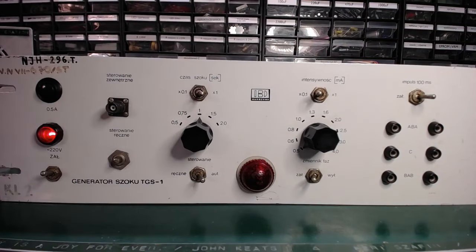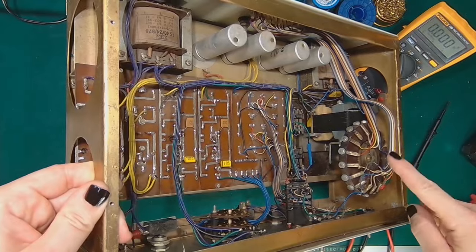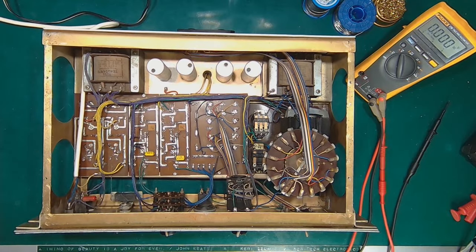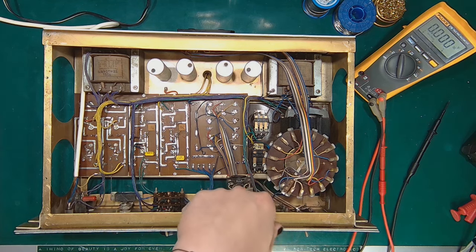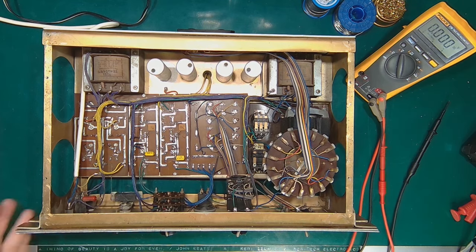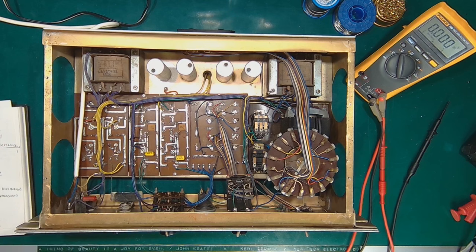And the whirring sound, you might be familiar with it, because you will see in a short while. Just one short look at it. So, here we've got this distribution switch, the motorized switch. This is actually where it comes from. And when going into the shock administration mode, the motor starts and applies the voltage to 18 rods in the Skinner box's floor. We'll see the schematics of this device pretty soon.